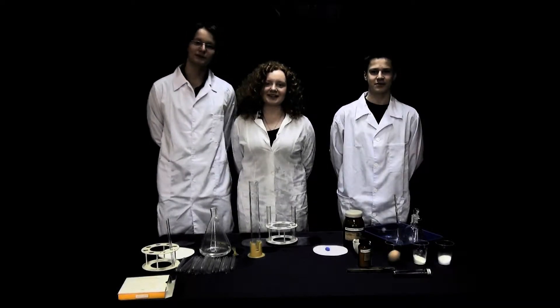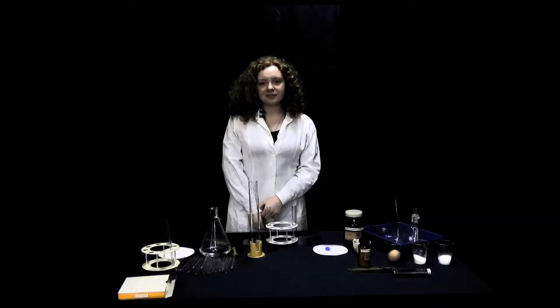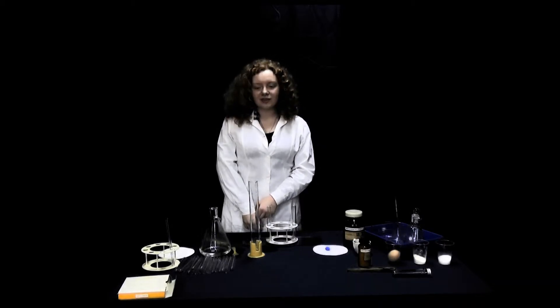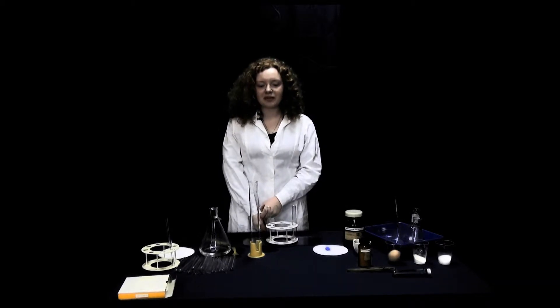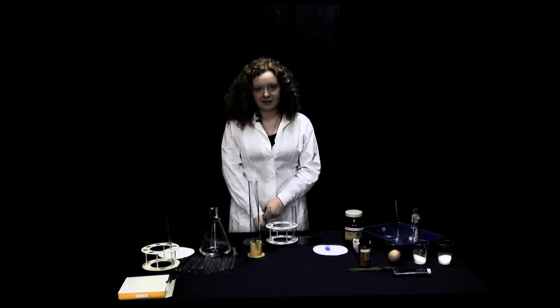Let's do some experiments! Experiment 1. Topic: Research on the influence of temperature on the speed of dissolving copper sulphate.